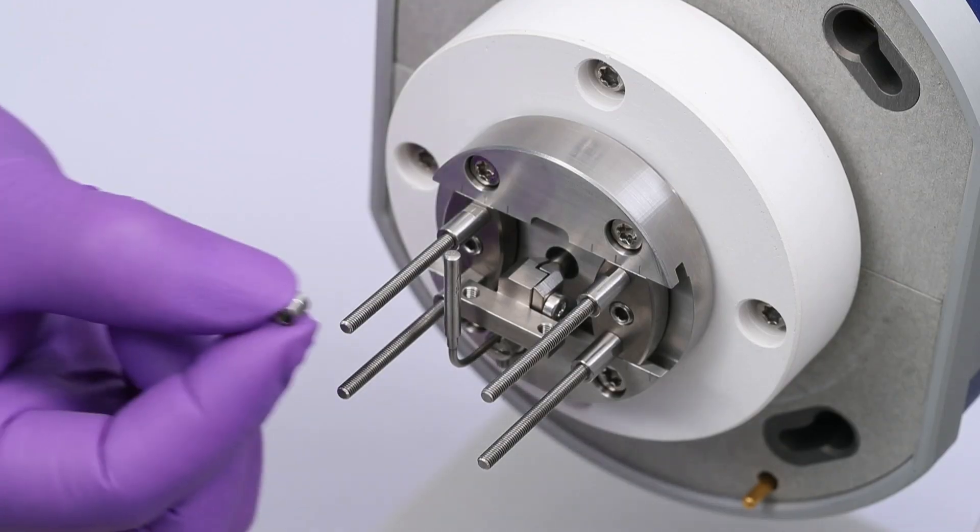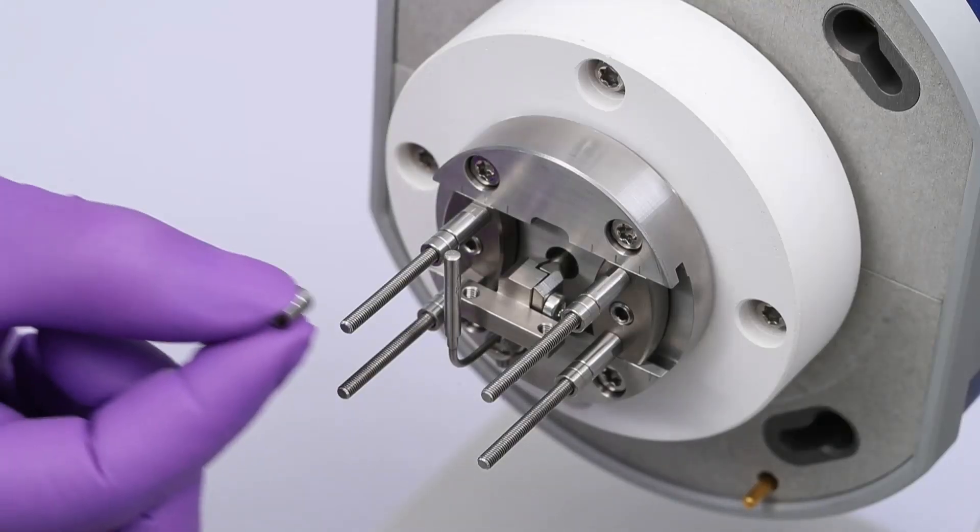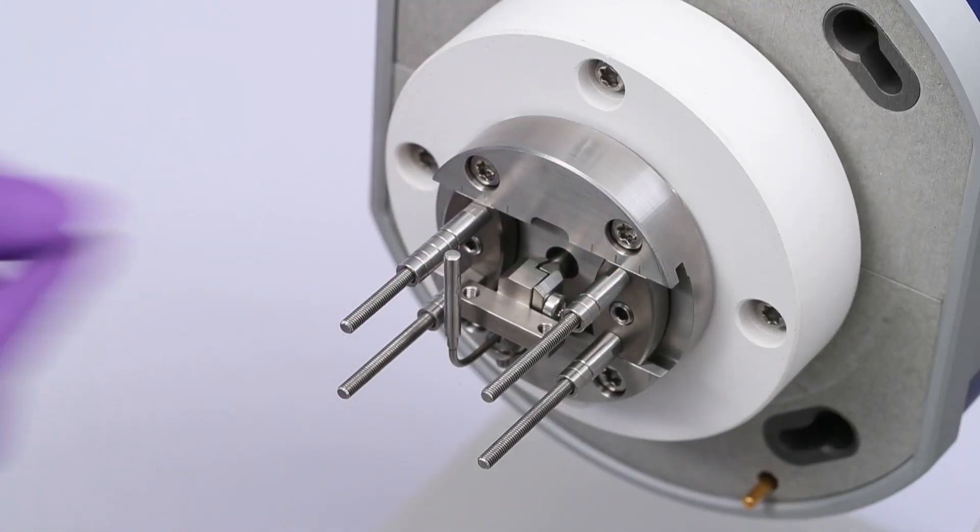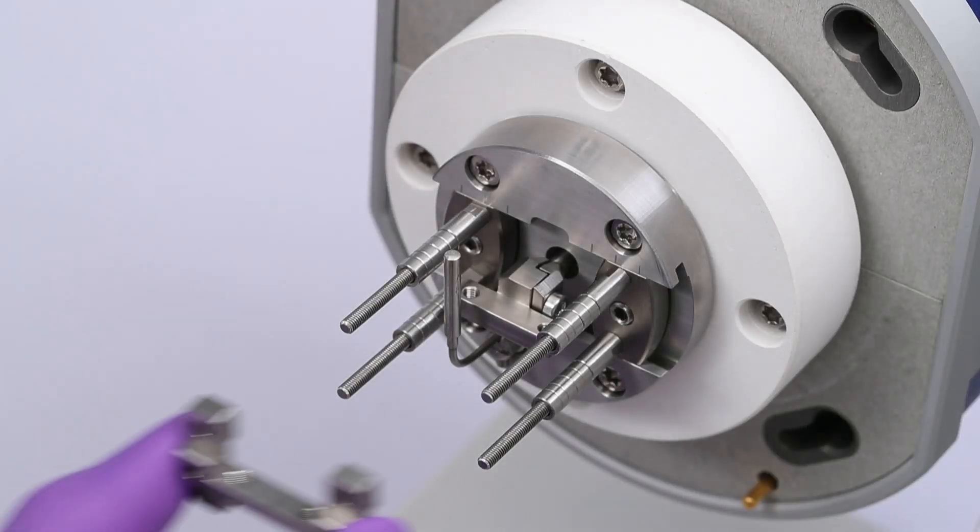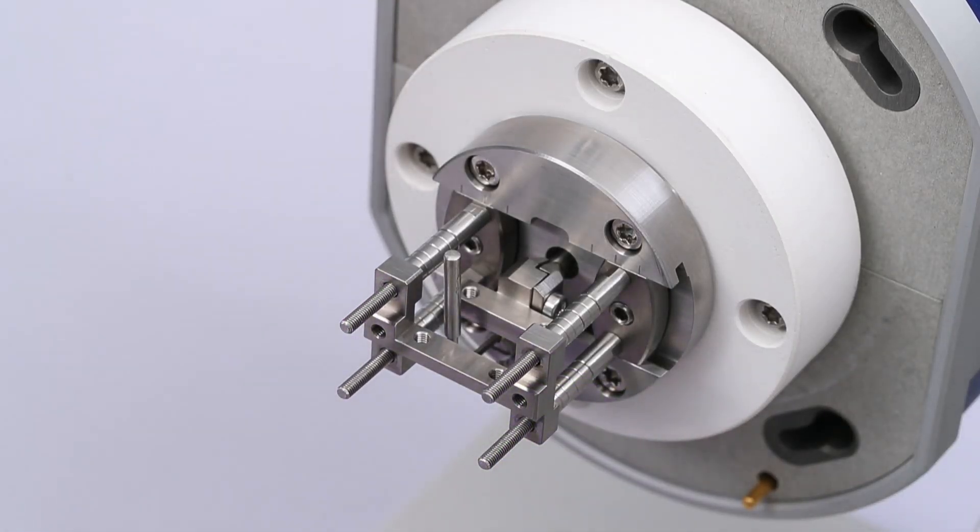Place the short and medium length spacers on the support pillars. Slide the fixed part of the tension clamp along the support pillars, inserting it through the corresponding four holes. The clamping surface of the tension clamp must be facing the same direction as the drive shaft part of the clamp. The holes in the clamping surface should be close to the far edge.